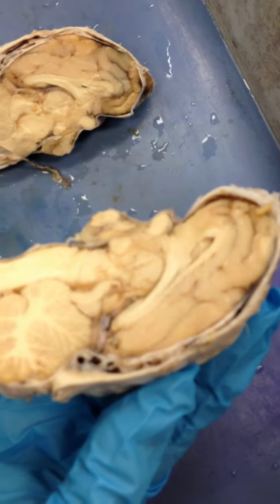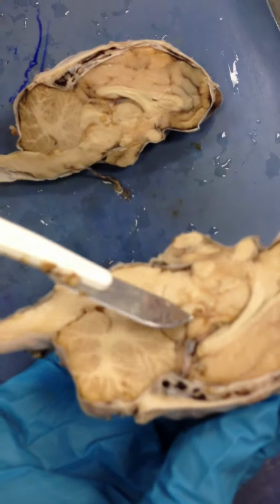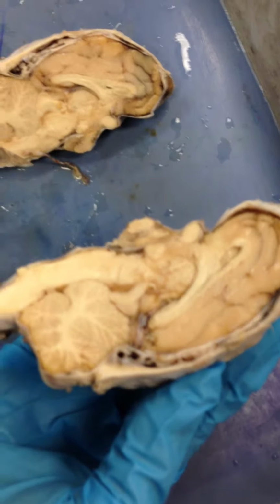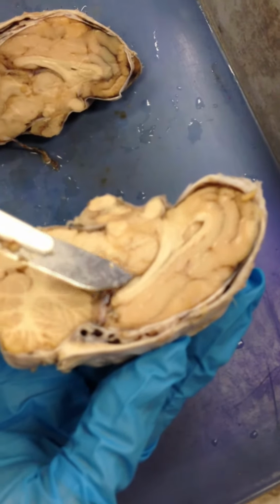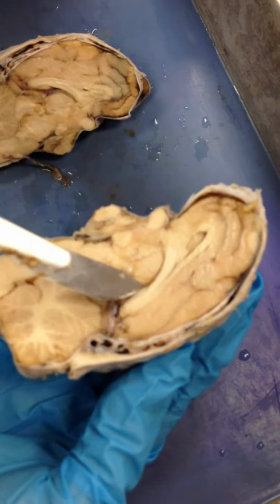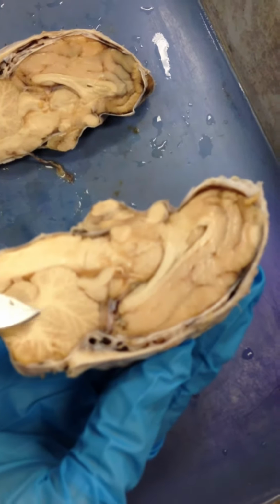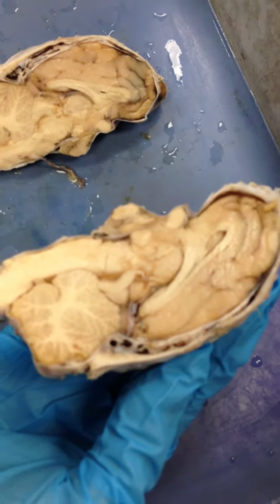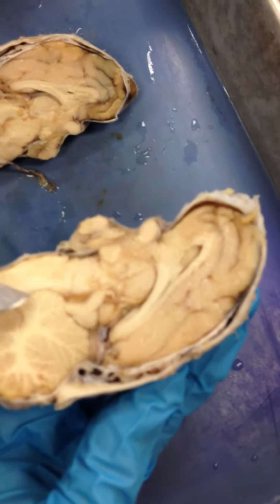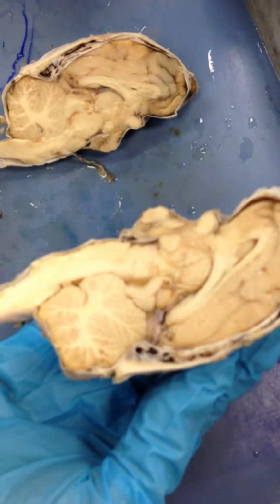Fornix, septum, corpus, parietal lobe, that's up here. Pineal gland? That's important. That one. Okay. What about the choroid plexus? Do we need to know that one? Yeah, which is right here in this groove, right below the fornix. Okay. And didn't you say these little tree-like things were the arbor vitae? The tree-like is arbor vitae, and the other portion is the folia. So the leaves are this part right here, and then the white matter is a tree, right?